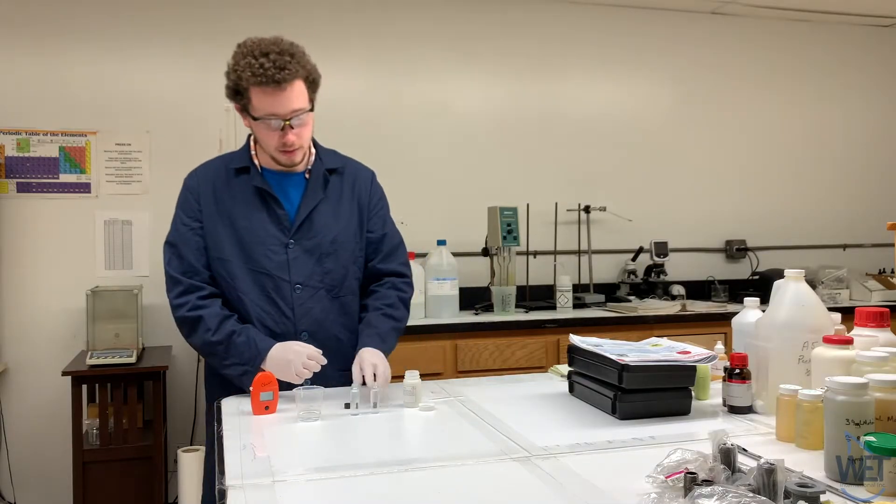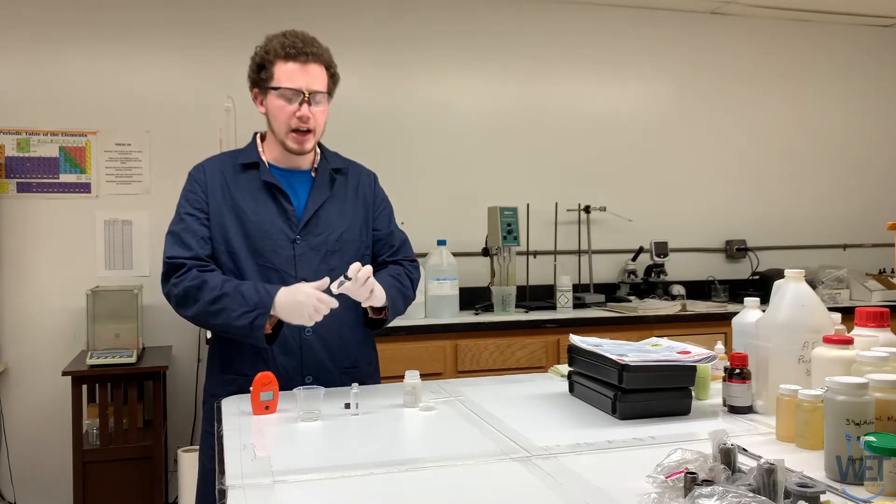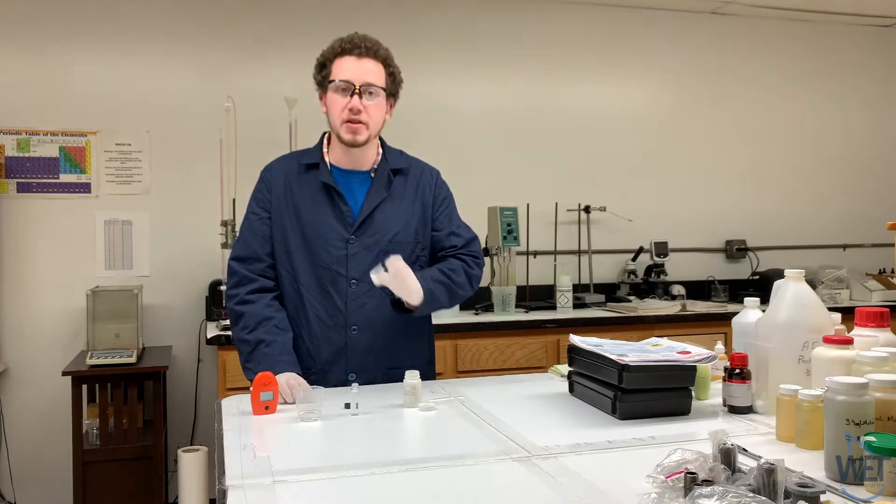Then you will cap it and mix, and let it react about three minutes, mixing throughout that time.